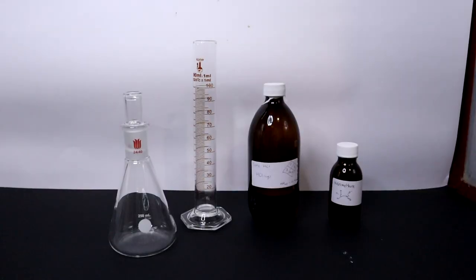Hi YouTube and welcome back to my lab. In today's episode I will be making hydroxylamine hydrochloride from the reaction of nitromethane with hydrochloric acid.